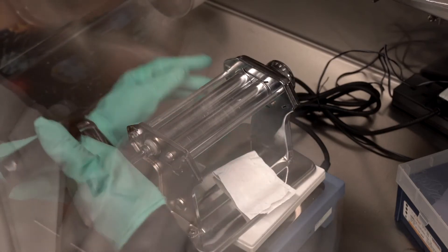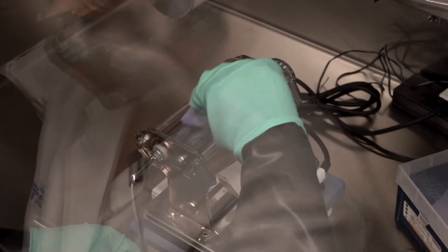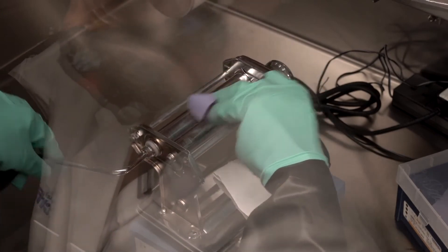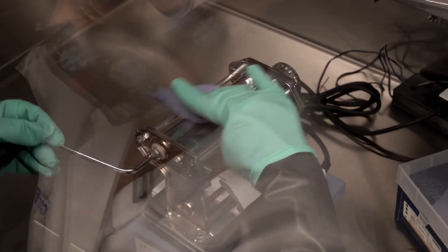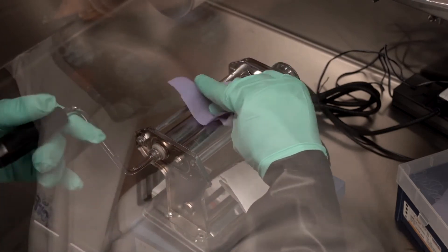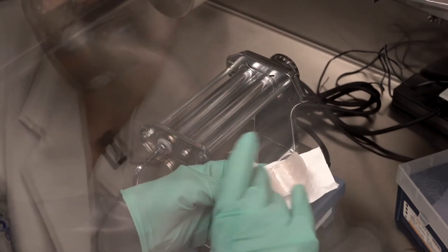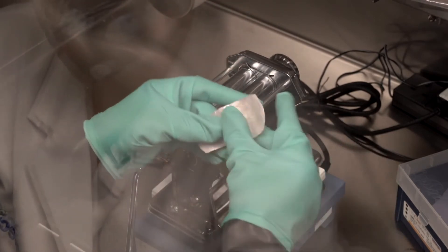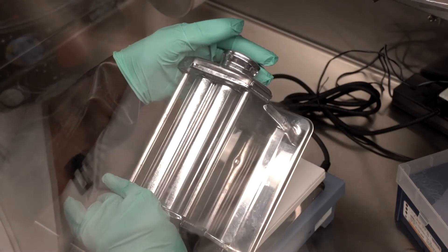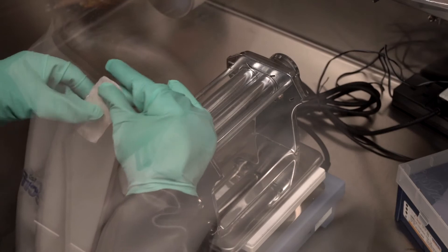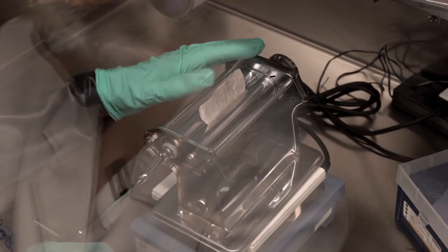That's working out pretty well. Getting a bit of separator dust on the rollers. I'm at my narrowest gap size now, so I have to be really careful. This will get me the thinnest possible sheet.